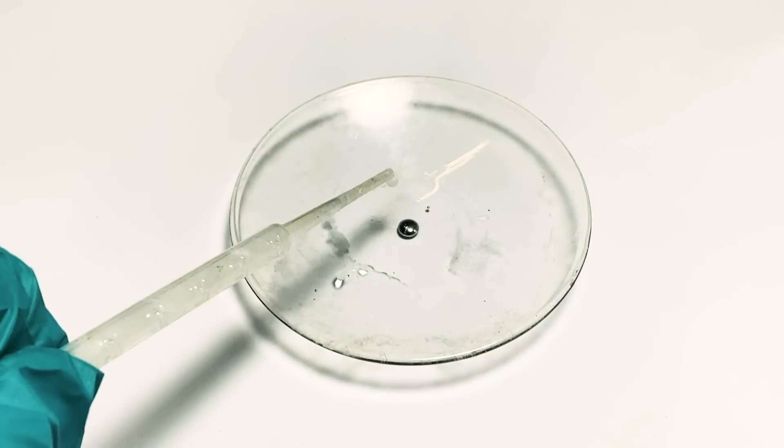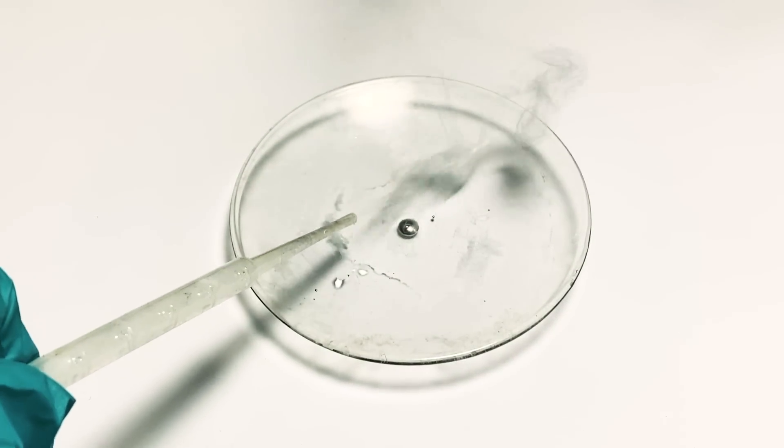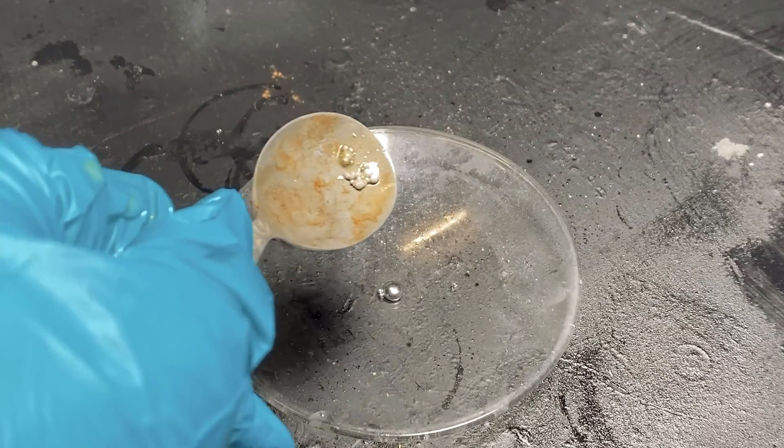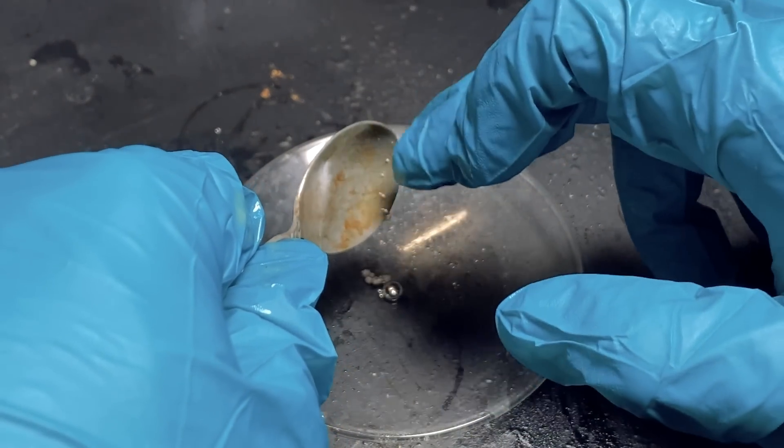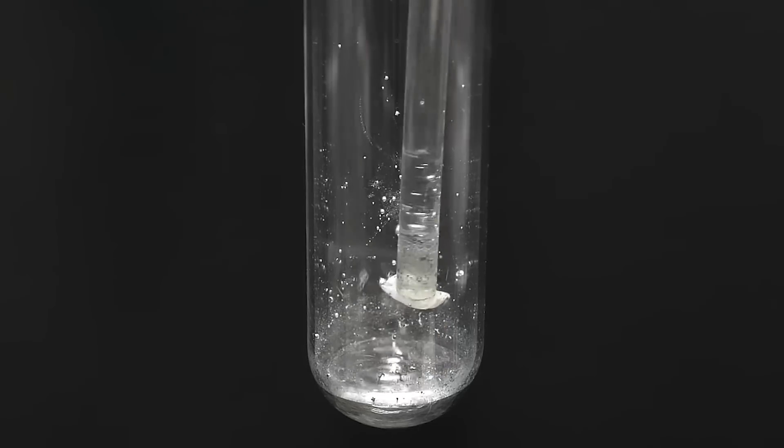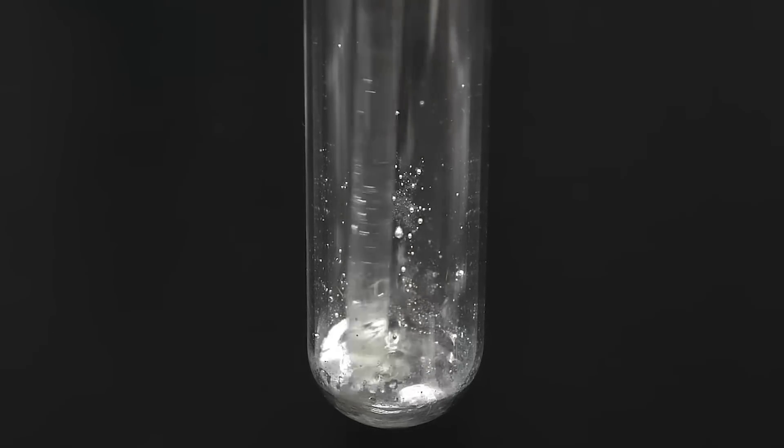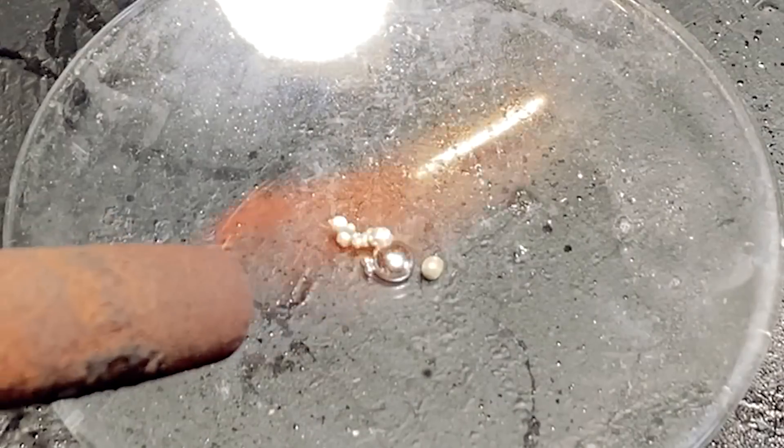And that's because I forgot that to make the mercury sponge, I have to make the sodium amalgam. For that, I've wiped down the water, and I've thrown in some sodium to make the sodium amalgam. And once again, nothing was happening, but don't worry, I've watched NileRed and I remember that you have to heat up the sodium so that the mercury can react with it. And so I did.